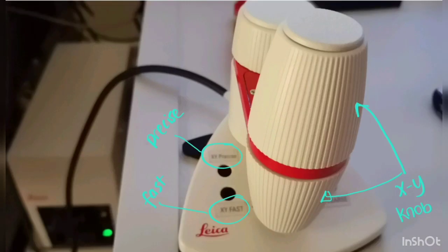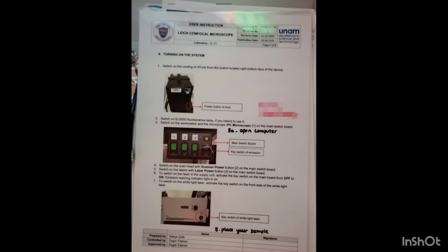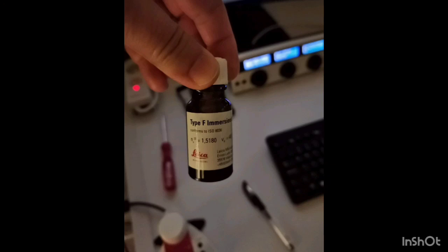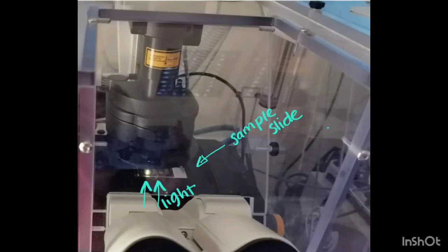We have the printed guidelines for the opening and closing of the system, which you can find next to the computer. Immersion oil is to be used for oil objectives. Here you can see the immersion oil that we use, and the microscope. The objectives are at the bottom, and light passes through the sample.